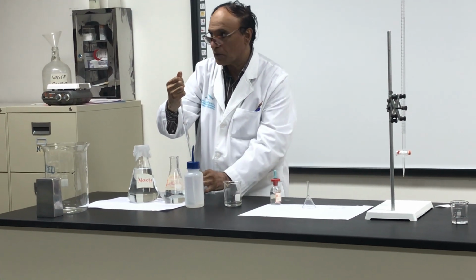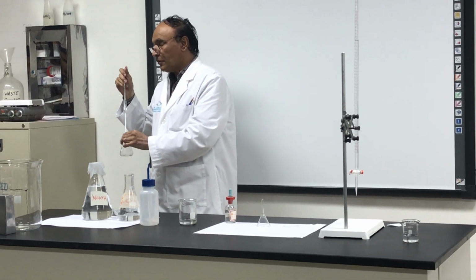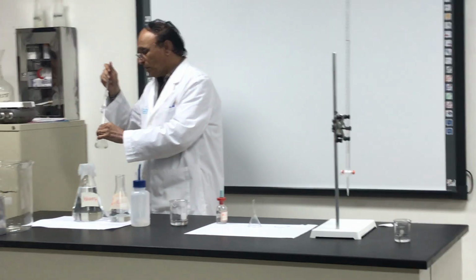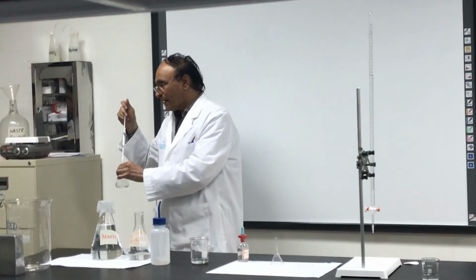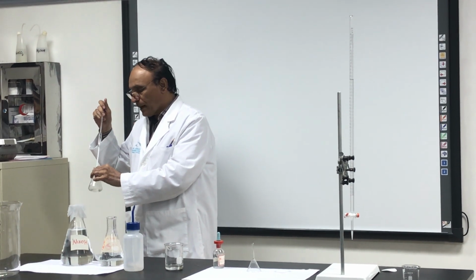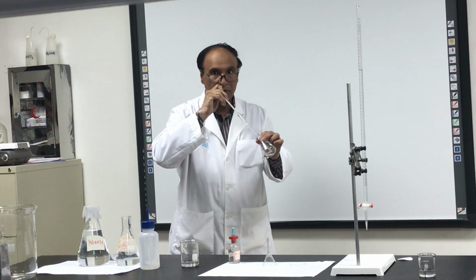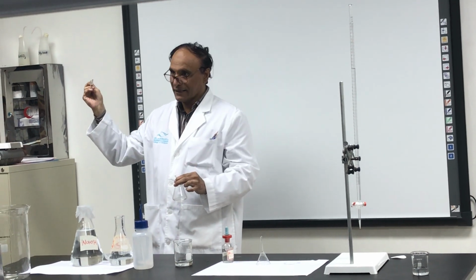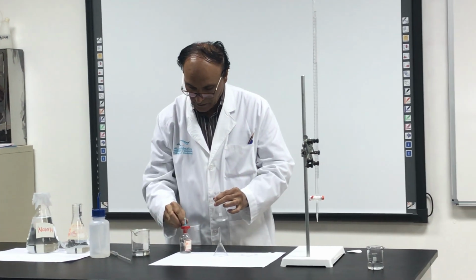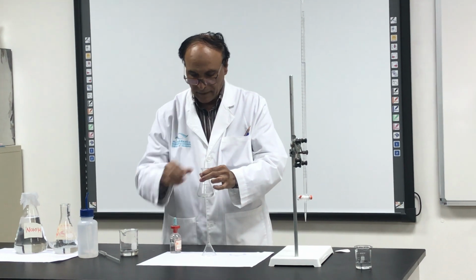This should be close to you. You are doing it the first time, maybe many times you have to do up and down, so don't do it wrong. Take up to the mark. No hurry. When it finishes, 1, 2 times, and leave it like that. And then you put 1 or 2 drops of the indicator.